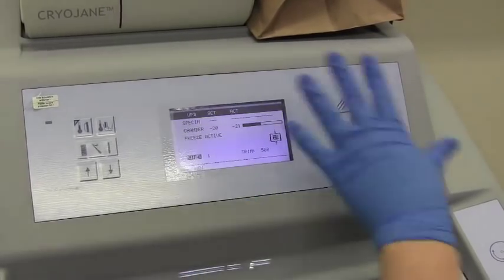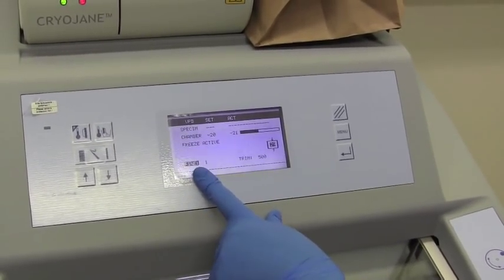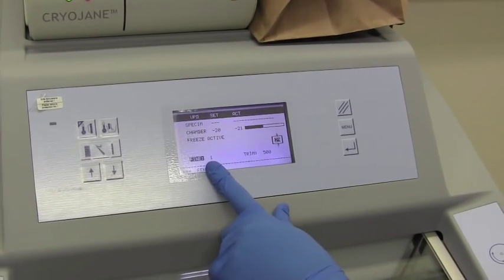So to familiarize you with the screen setup here, what you see is our fine cutting thickness, which is set right now to 1 micron.